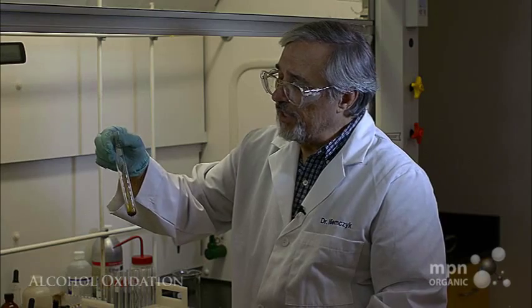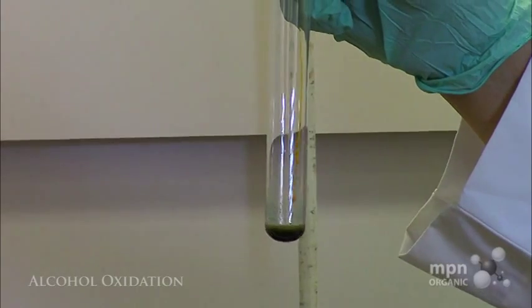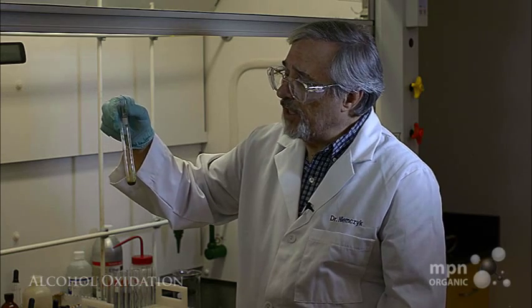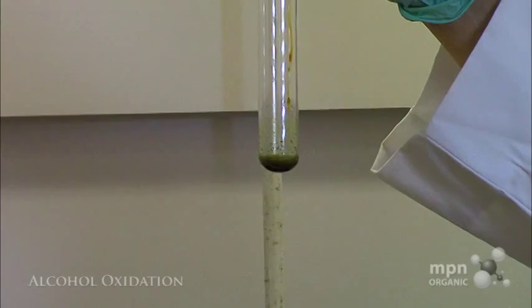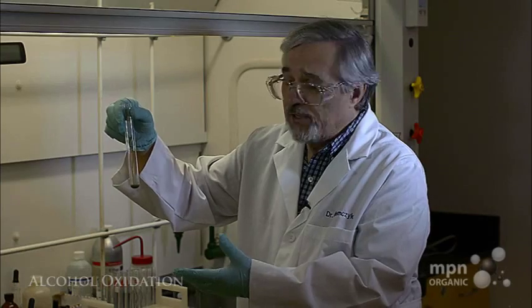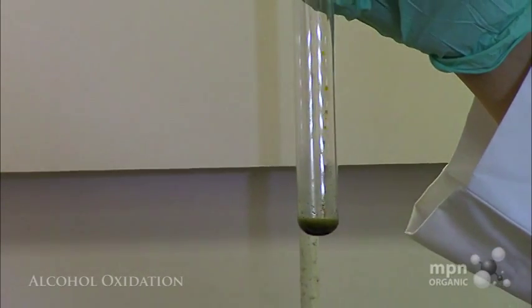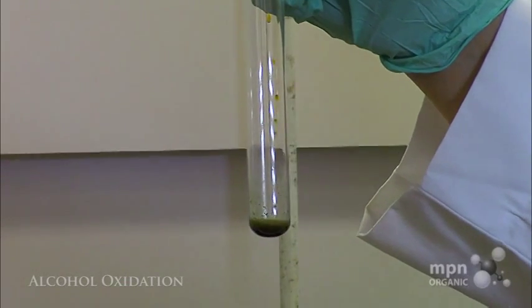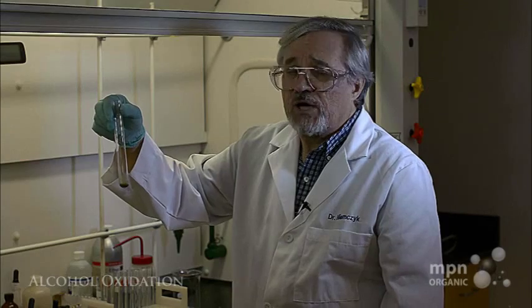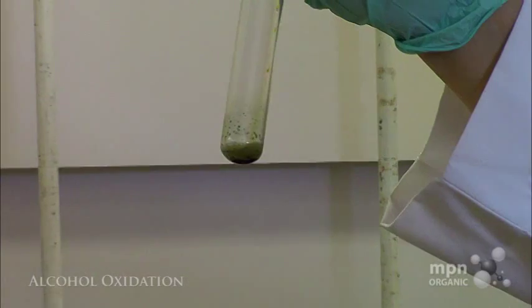You can see there's an immediate color change. We went from the dark orange-brown, which is evidence for the chromium +6 oxidation state, to the green color, which is indicative of the Cr+3 ion. And so we have a reduction of the chromium in the chromic acid, and we have an oxidation of the alcohol. Now in this case, because there's some water in it, the primary alcohol gets oxidized first to the aldehyde, and then with the water present will become oxidized up to the carboxylic acid. So right now we've got hexanoic acid in this test tube.